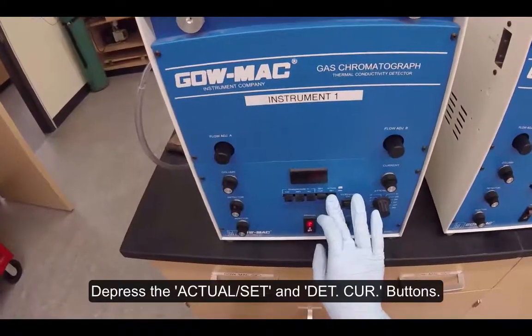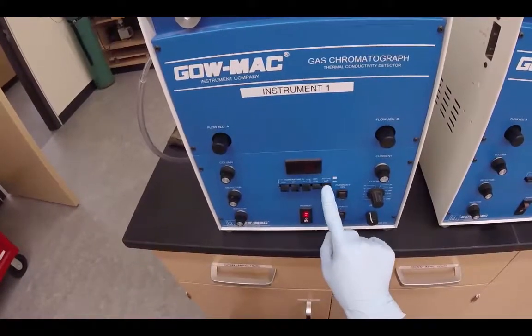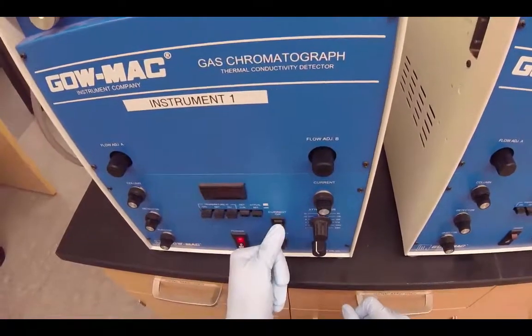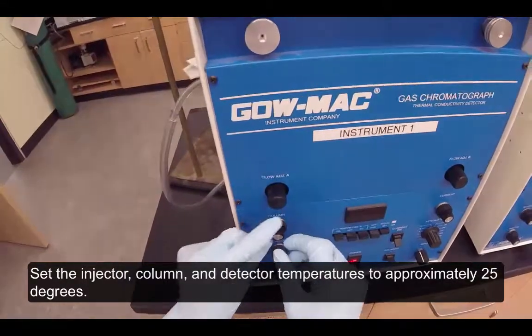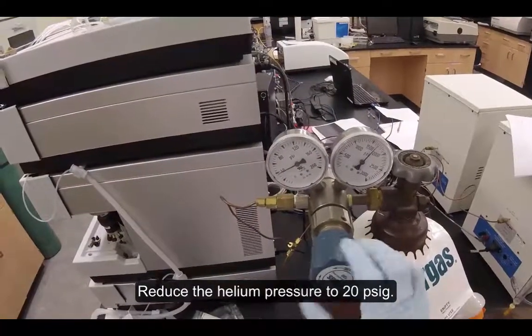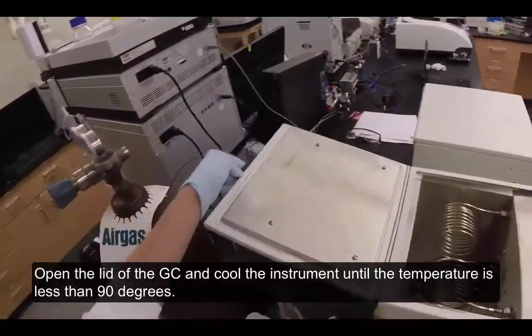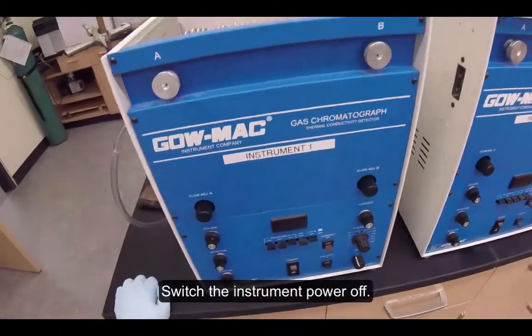Depress the actual set and detector current buttons. Turn the current knob fully counterclockwise and switch the current off. Set the injector, column, and detector temperatures to approximately 25 degrees. Reduce the helium pressure to 20 psig. Open the lid of the GC and cool the instrument until the temperature is less than 90 degrees. Switch the instrument power off.